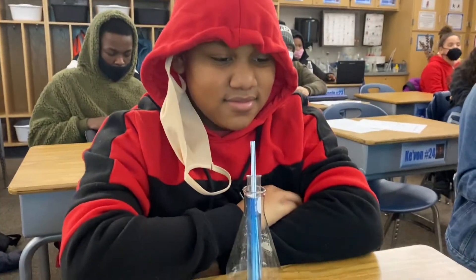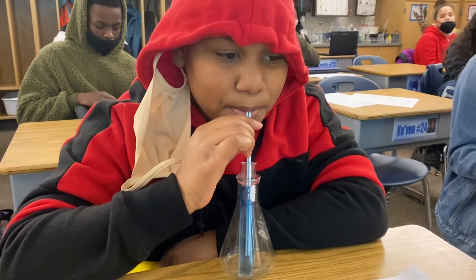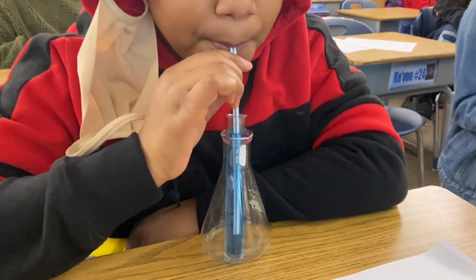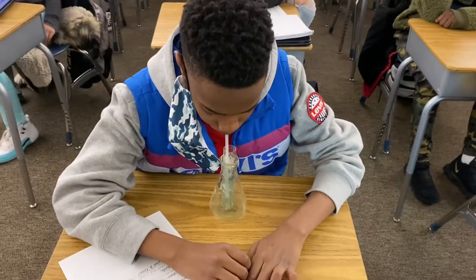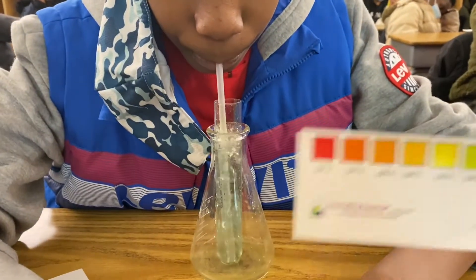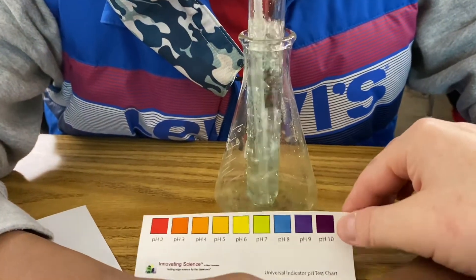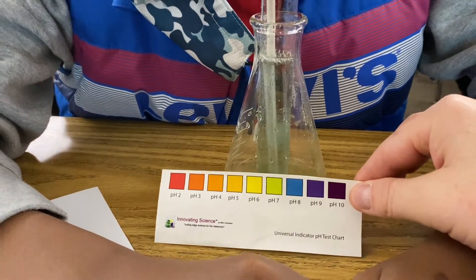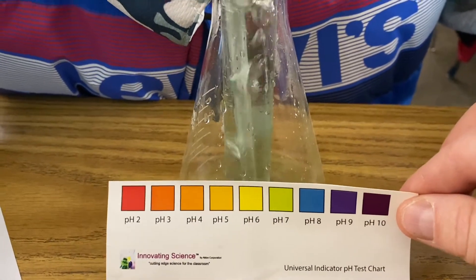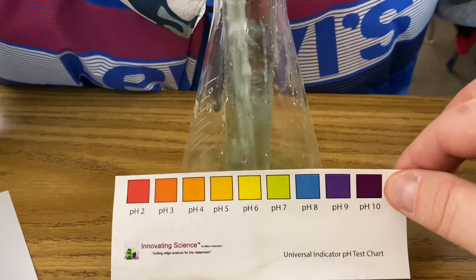We want to find out what happens when Javion blows carbon dioxide from his lungs into the test tube. Here with Eric, he is adding CO2 from his lungs to the water to make carbonic acid, and it has changed from blue definitely to a green. It looks like it's starting to get closer to a yellow as that CO2 makes carbonic acid in the water.